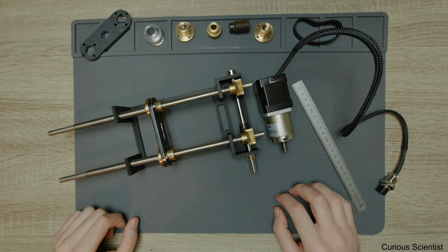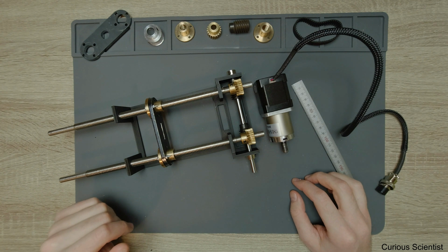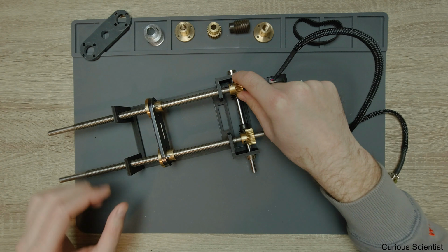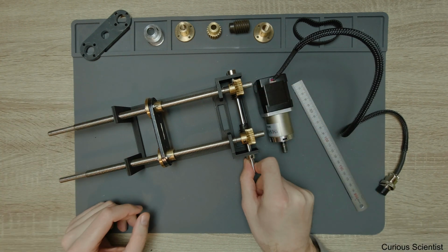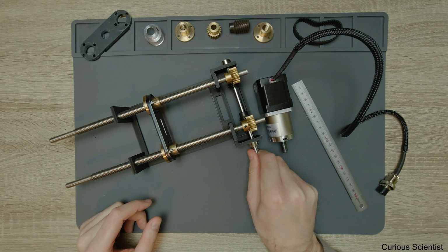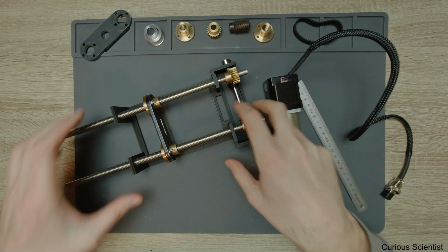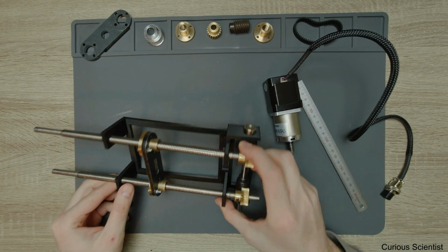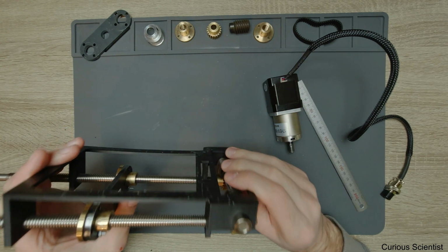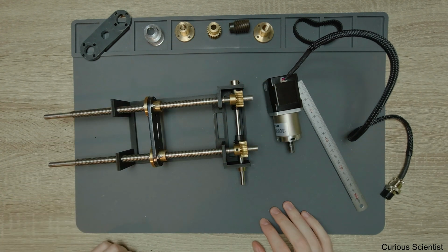So I hope that this update was somewhat informative, and I could tell you some cool upcoming things that will be done with this machine. So you can see that everything works pretty fine, and the alignment and the dimensions are quite okay, and actually the print came out quite nicely. Of course you can see some small lines, but from a cheap printer it's not so bad.